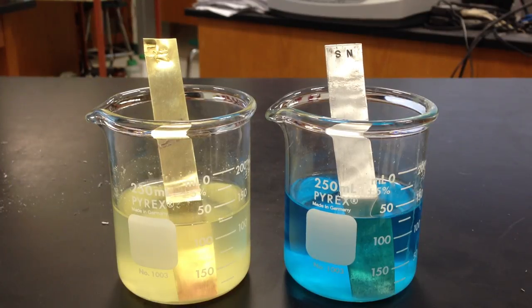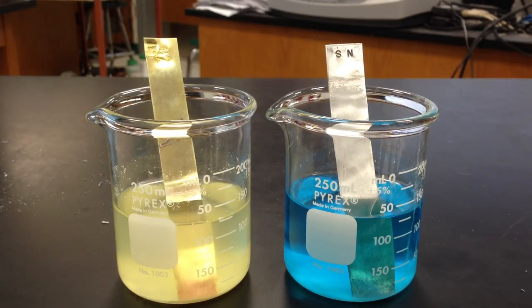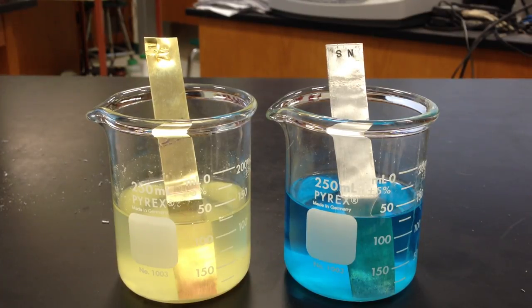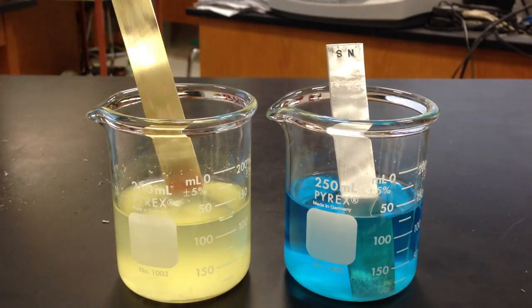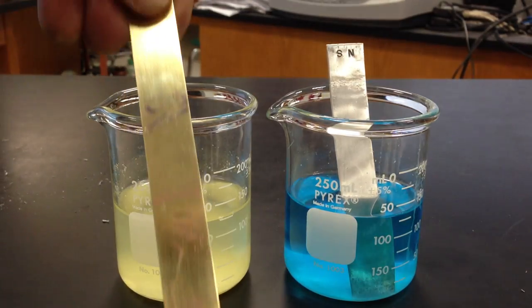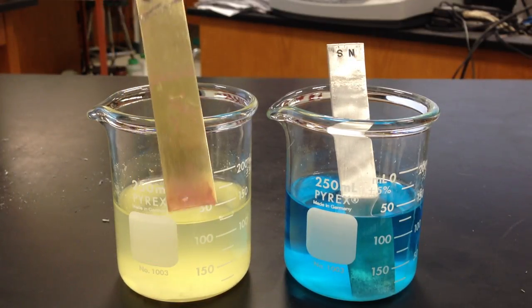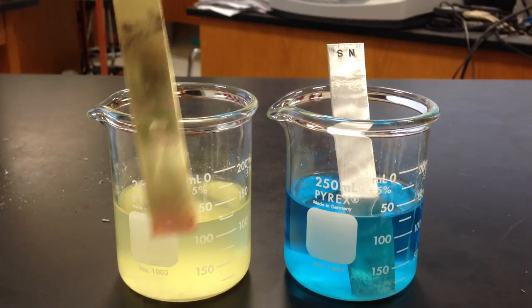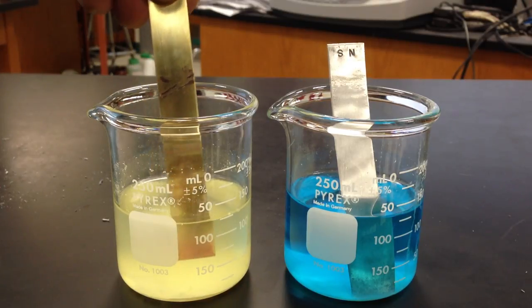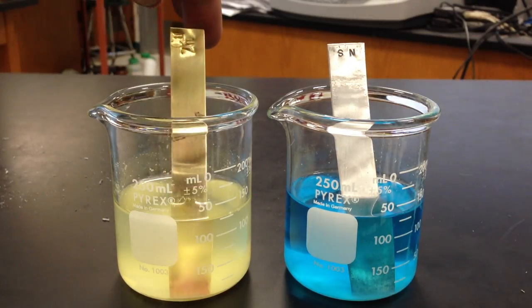In this case, there are going to be electrons transferred in one of these reactions. A positive voltage tells us there's a forward direction in that reaction. When we put the copper metal in the tin chloride, we get negative volts, because as you can see, there's no reaction. That negative voltage means we could force this to happen if we added energy — to force the tin 2+ to reduce onto the copper. It's poor at reduction, and we would need energy to do so. That's why this is non-spontaneous with a negative voltage.